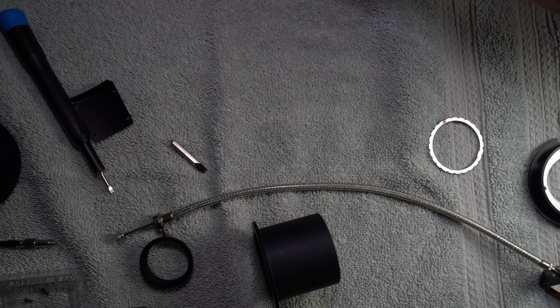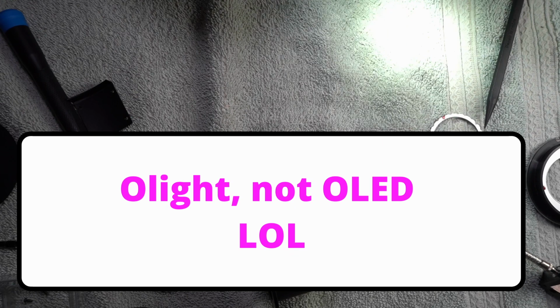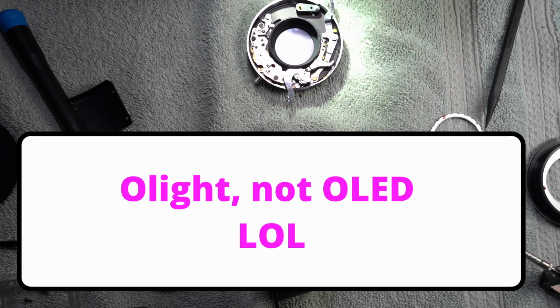And I'm going to check something really. I'm not going to do it over that. I don't want that mess on my hands. There's a couple places in here.